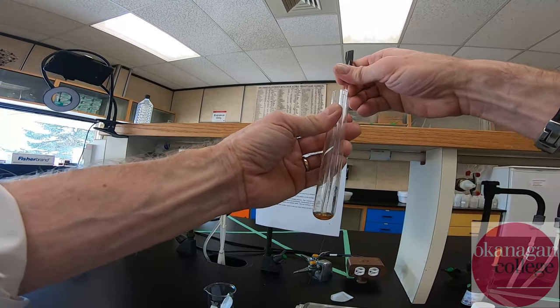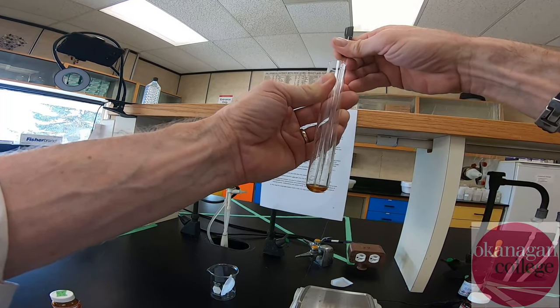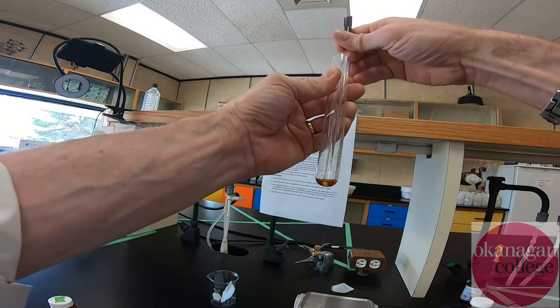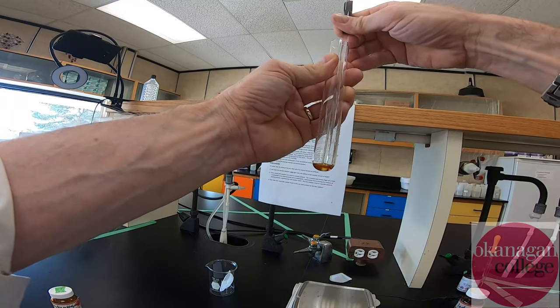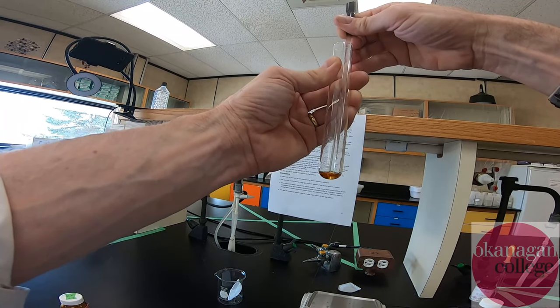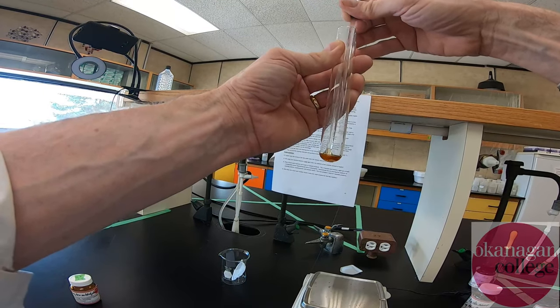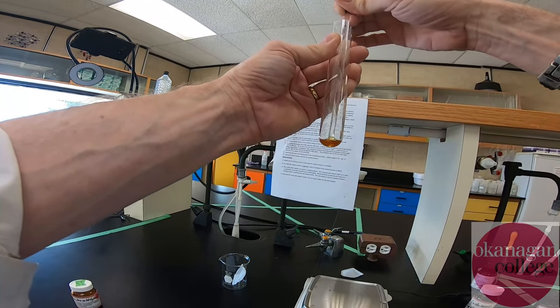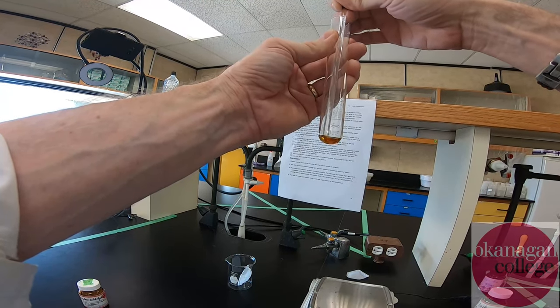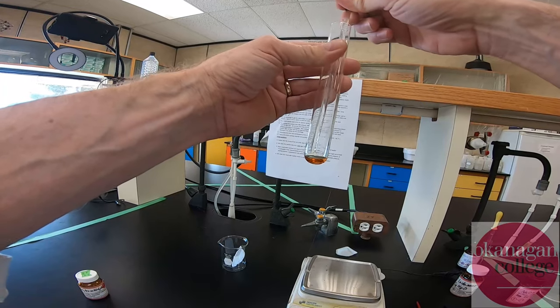We've been at it for about 10 minutes now. We've got a clear brown oil with a small amount of solid material in the bottom of the test tube. It's important that everything be fully dissolved before we add the catalytic sodium hydroxide — it gives everything a chance to react. It's a little tedious but we want to make sure everything's fully dissolved. Each compound acts as a co-impurity. After about 10-15 minutes we do have everything nicely dissolved.